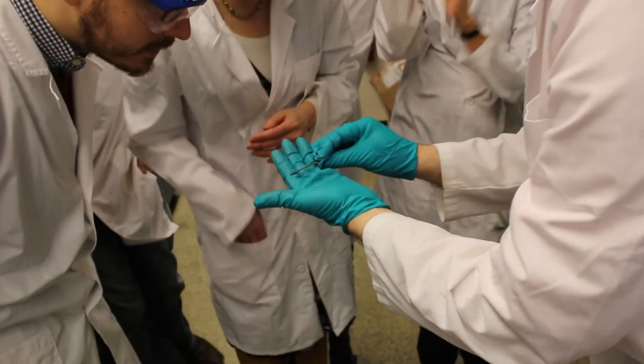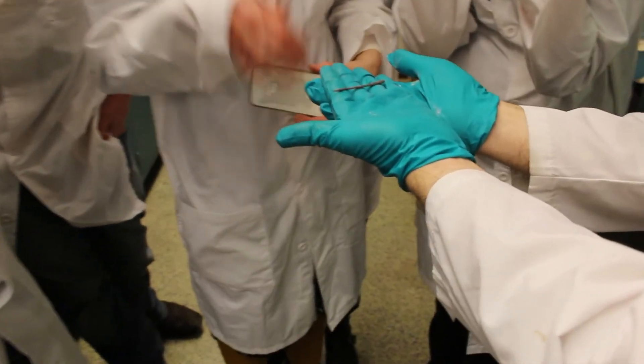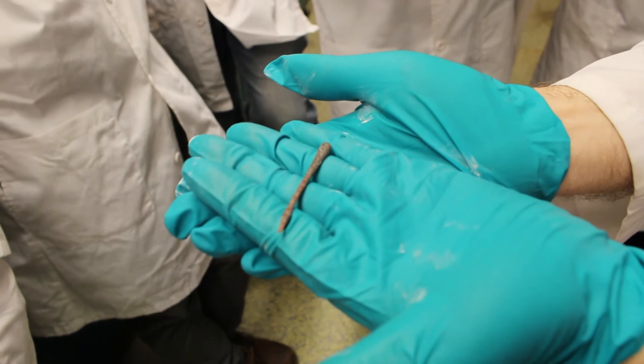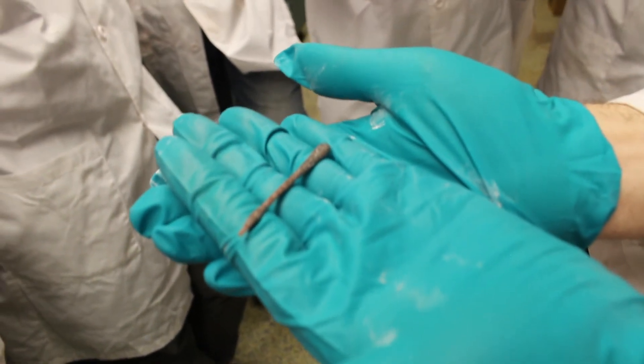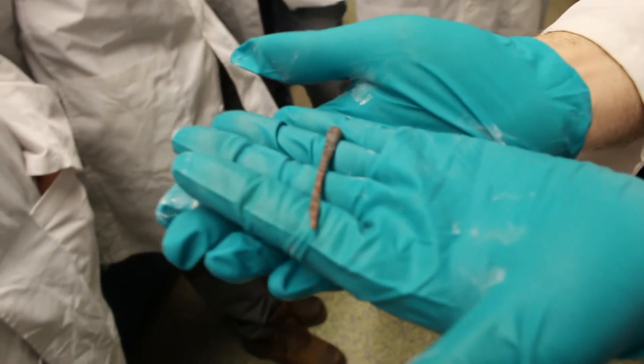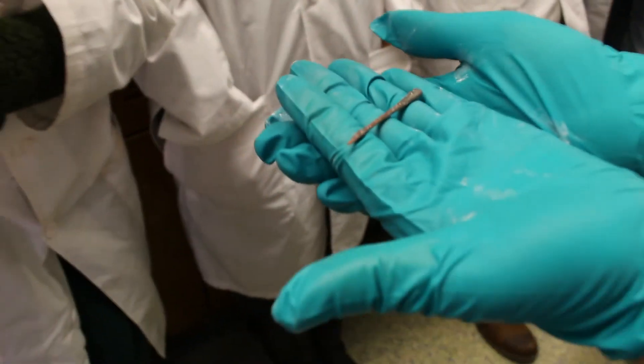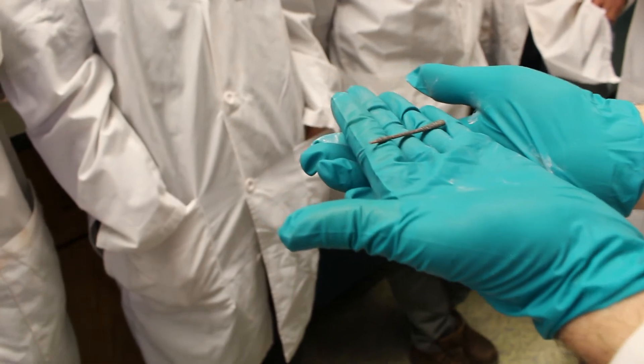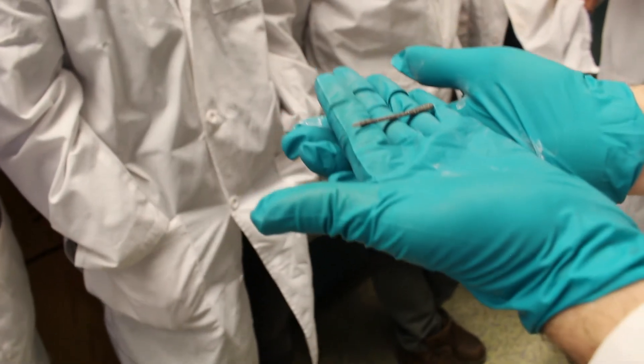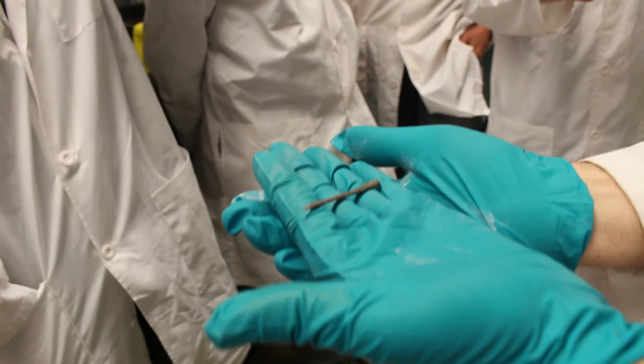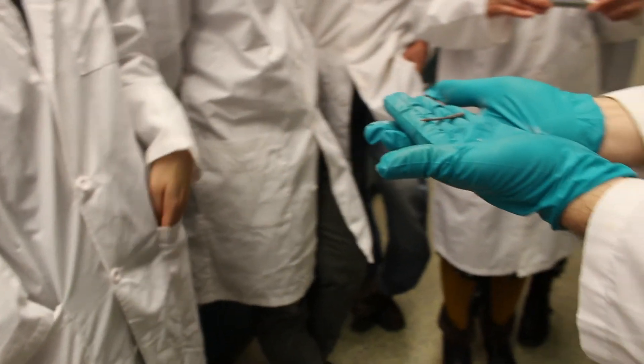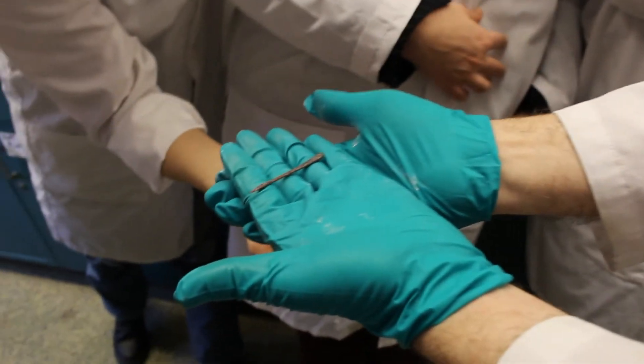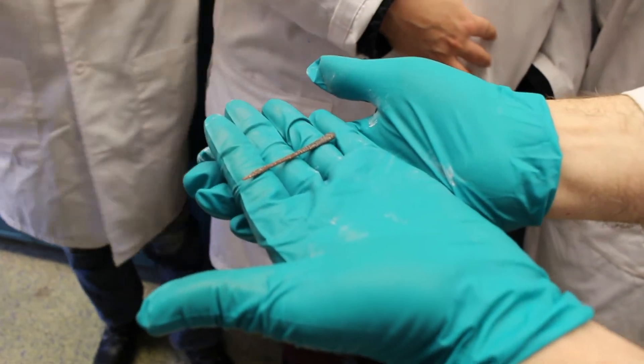What happens is, let me show this to you. See, it's got a nice color, but it's not vitreous at all. Oh, wow. It's crystalline. See? And it's certainly not a beautiful, golden, transparent glass, which is what Valentine says you're going to get. And you know how annoying it is when he apologizes that this is the simplest possible operation? Every tyro in the art knows how to do this. I'm sorry to have to bother telling you how to do it. And I can't do it for months at a time.